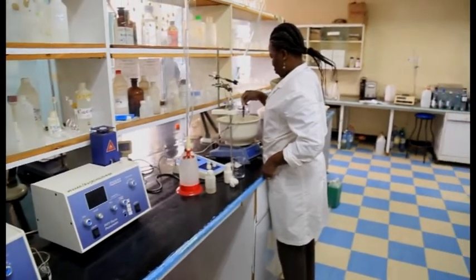And finally, the other service is sampling. On request, since the lab has the expertise, we can help our customers sample their waters for laboratory analysis. This is more important when it comes to samples for bacteriological analysis, because such samples are quite sensitive and vulnerable to external contamination. So in that case, if a customer requests that we help them do their samples, we can also carry out such services.